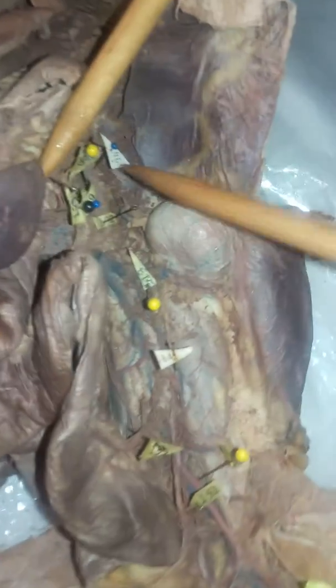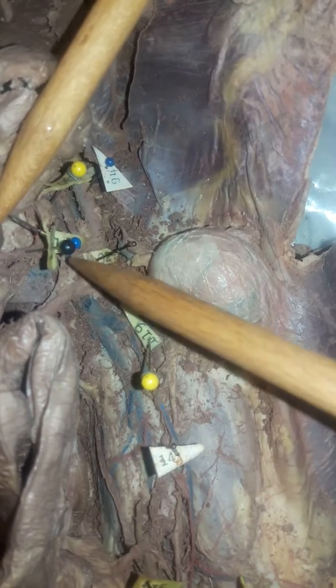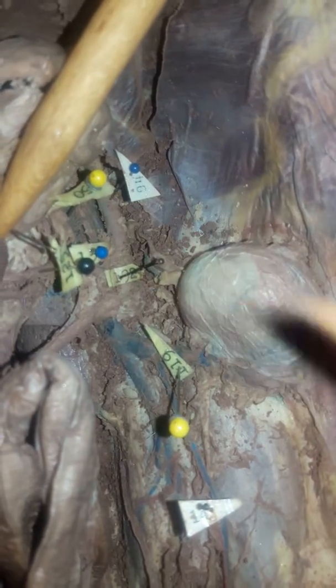Go ahead and zoom on in. Right here, we're going to start off where 94 is. That's the abdominal aorta. Going to move on down to where 192 is. That's the celiac trunk. We got 3 branches coming off that. 125 here is the splenic branch or splenic artery. 139 is the gastric artery. And then we got 150 over here, which is the hepatic artery.